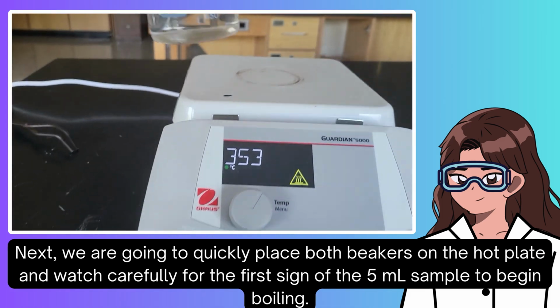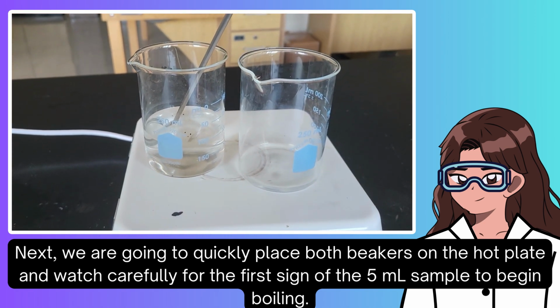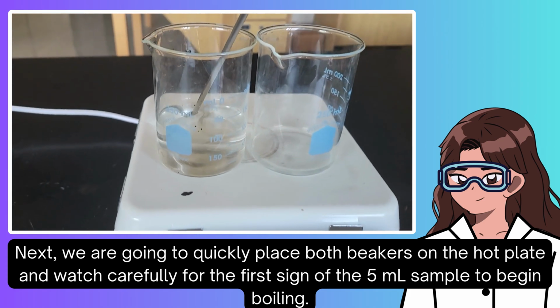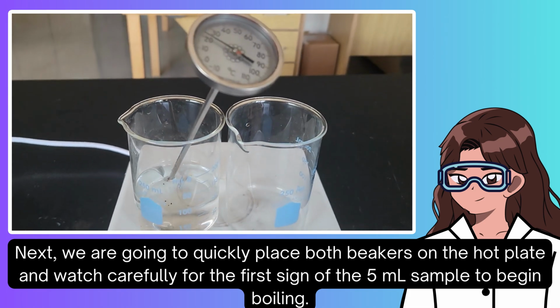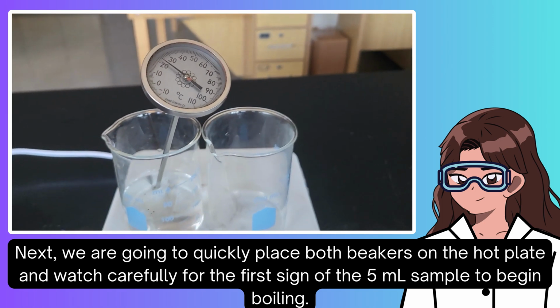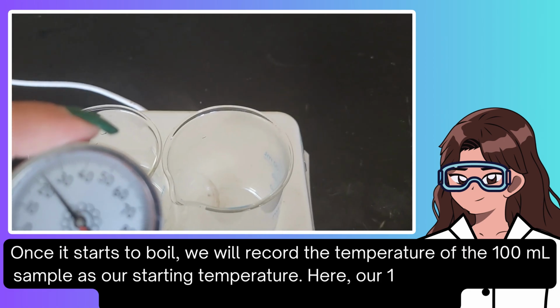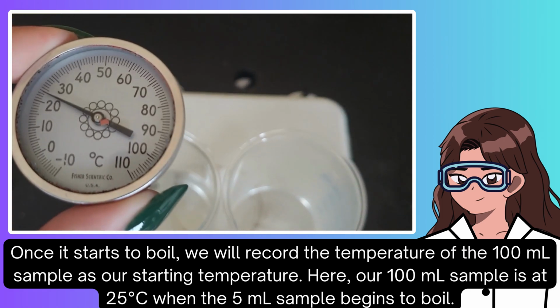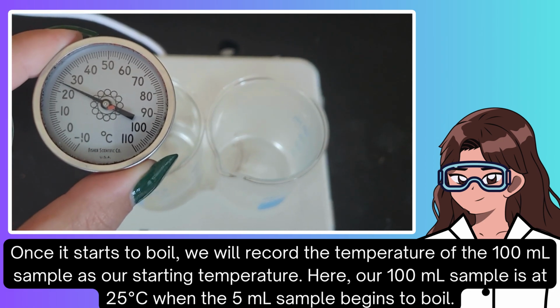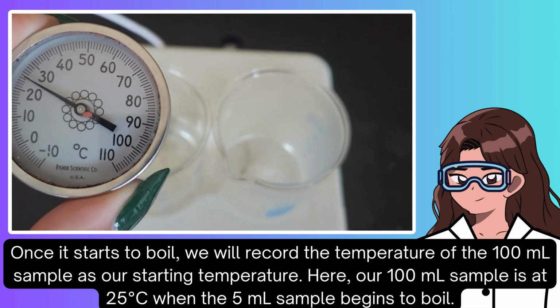Next, we are going to quickly place both beakers on the hot plate and watch carefully for the first sign of the 5 milliliter sample to begin boiling. Once it starts to boil, we will record the temperature of the 100 milliliter sample as our starting temperature. Here, our 100 milliliter sample is at 25 degrees Celsius when the 5 milliliter sample begins to boil.